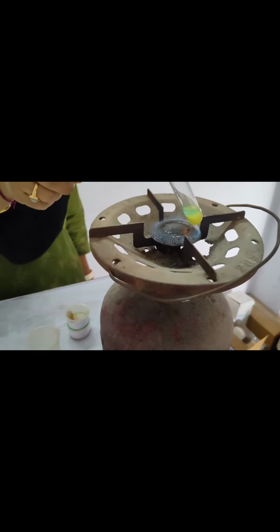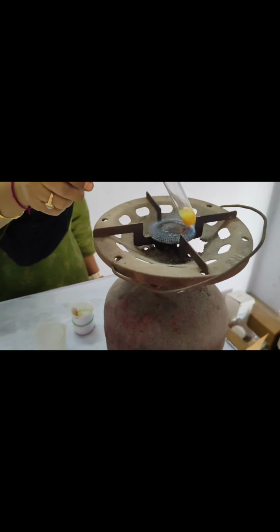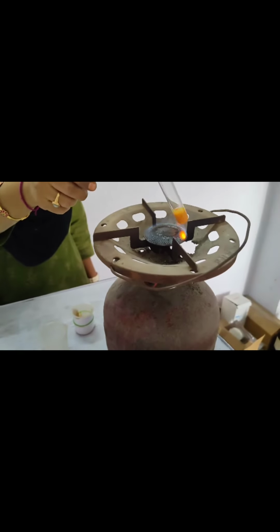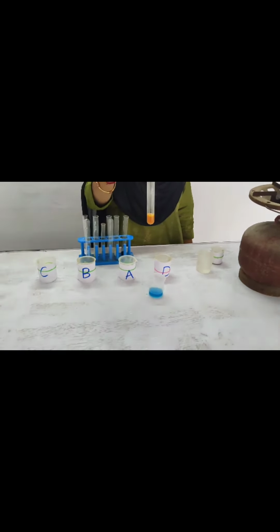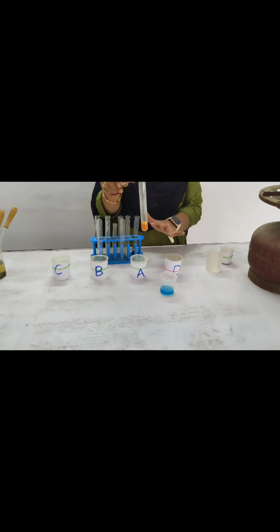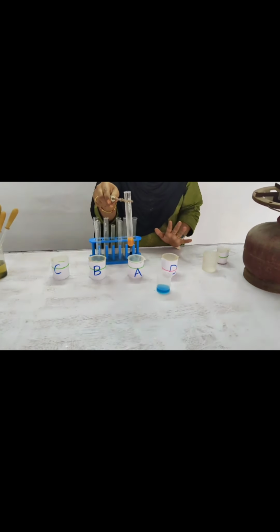So whatever the color, we have different colors based on the concentration of the sample. It appears in green color, yellow color, orange color and brick red color. So based on the color, we have to identify the percentage of glucose. For example, green is 0.5%, yellow 1%. If it is orange, it is 1.5%. If it is brick red color, it is 2%. So whatever the color, you have to remember the percentage of glucose also, because the external examiner may ask the percentage based on color.